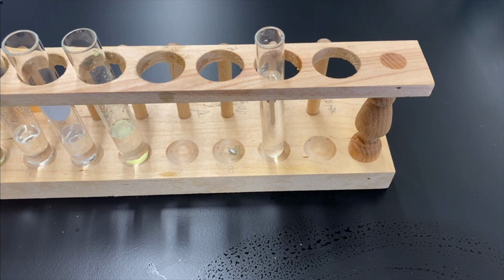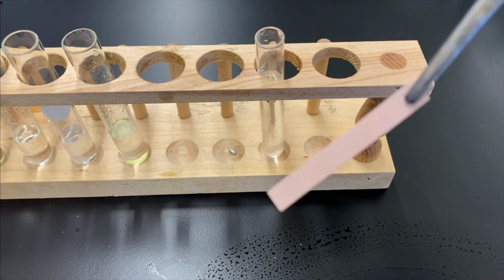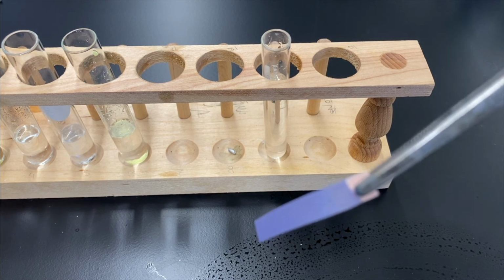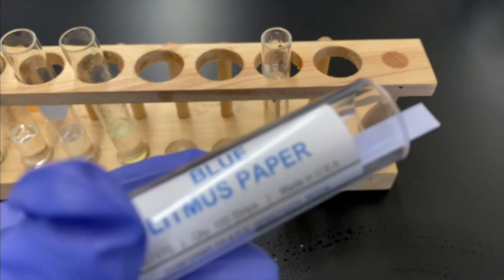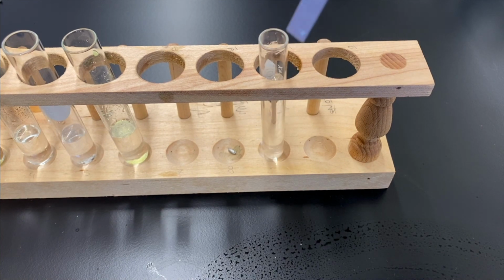What could this mean? Well, not really quite sure right now, right? Let's just test it. Remember last time, before we added more base, our red litmus, whoa! We just put in red litmus paper and it's blue. So it's still basic. Makes sense. I mean, if you're adding concentrated base to an already basic solution, it would stay blue. Okay, blue staying blue, still basic.